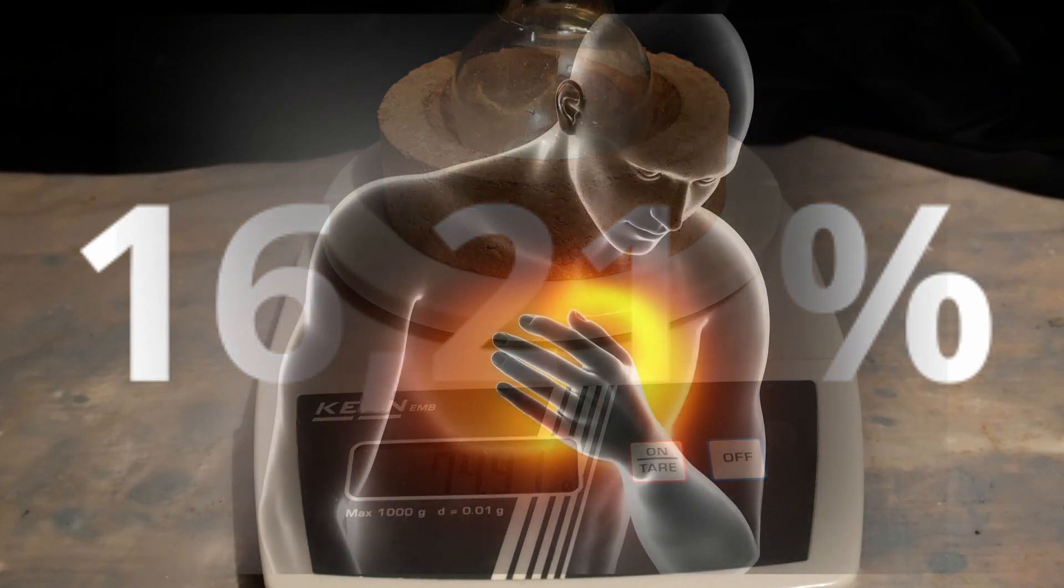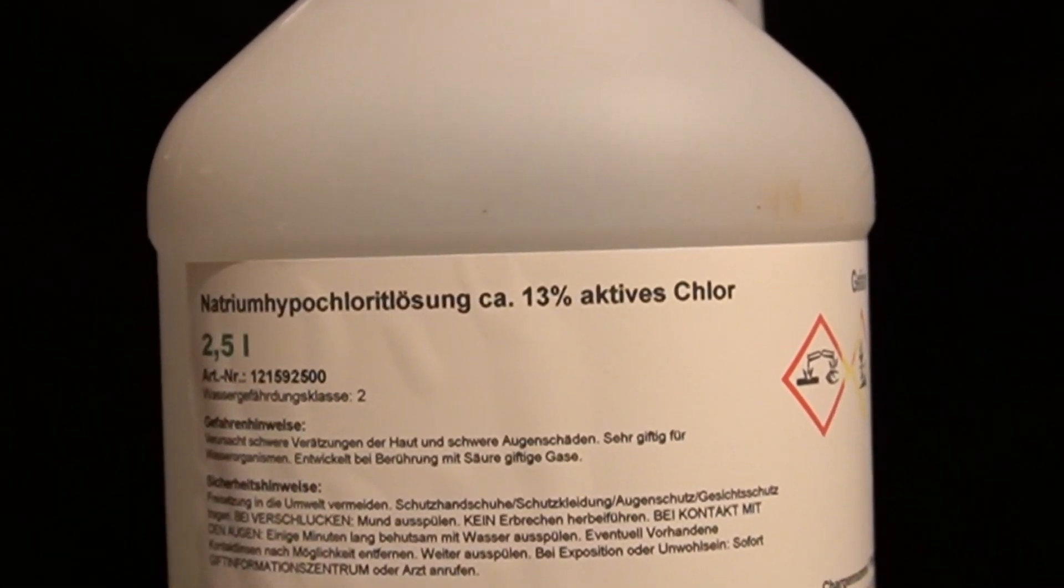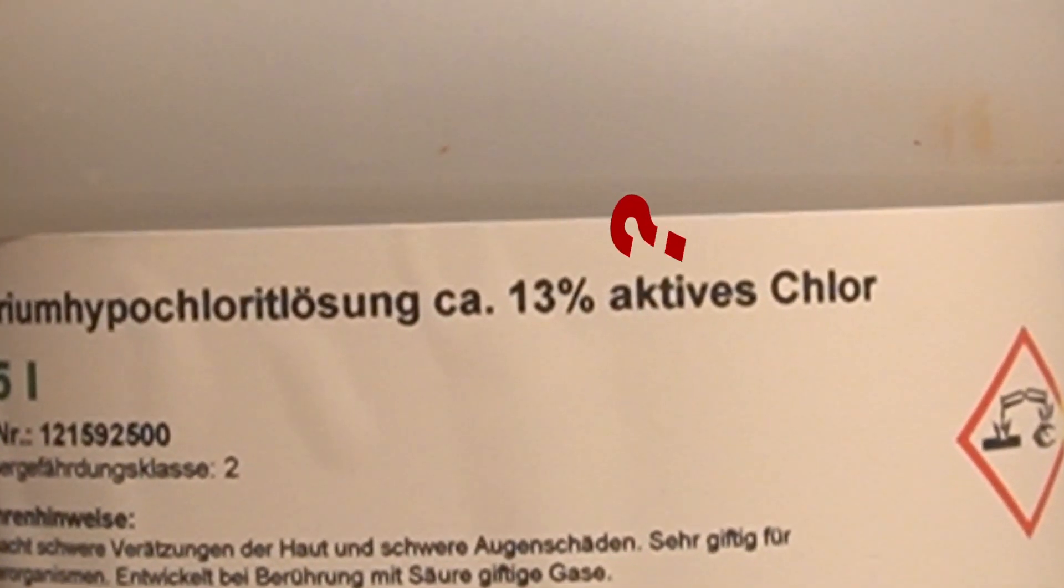So this got me thinking. What if the concentration of my hypochlorite isn't actually 13%?